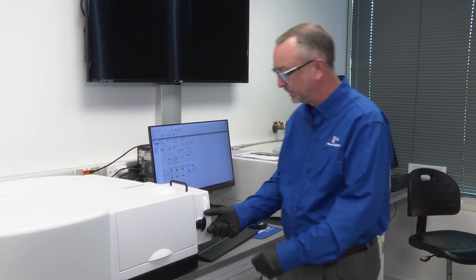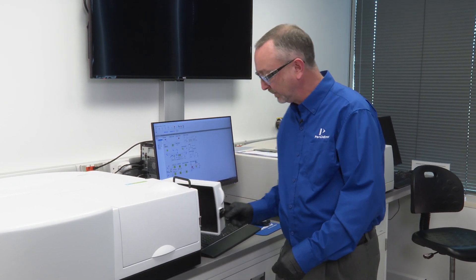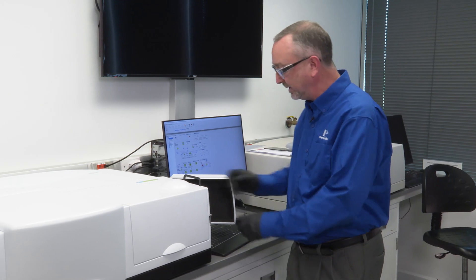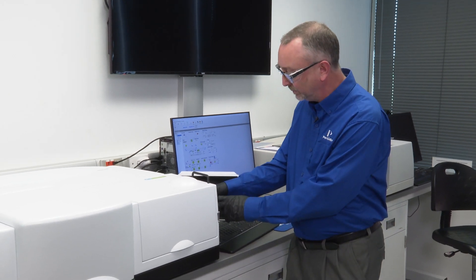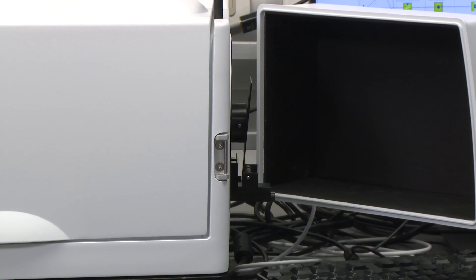Once again the 150 millimeter integrating sphere is your friend. Let's pretend we have a sample which I will place in the back.